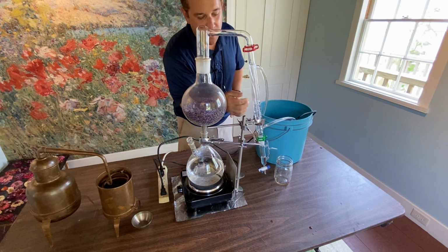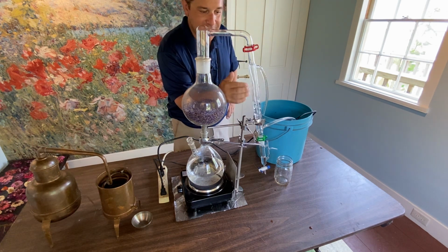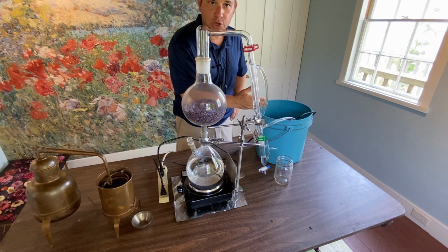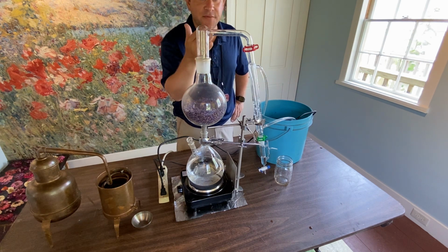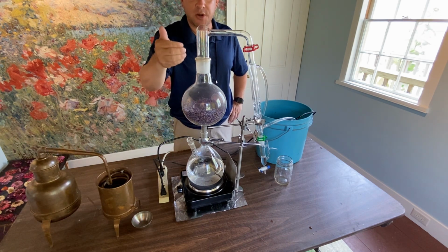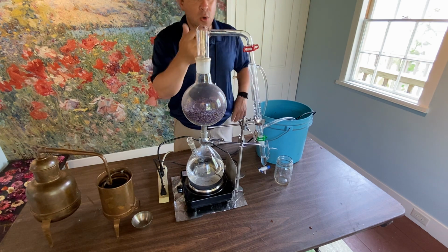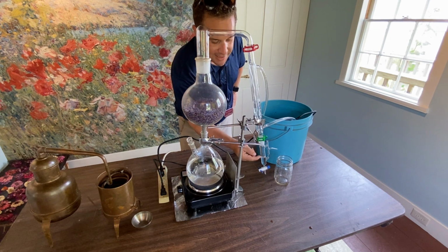So the inner tube that I'll show you in a bit with a little closer shot is where the steam accumulates. The outer tube allows really ice cold water to circulate around that tube with the steam. Now, eventually I'll put really, really cold ice in here, allowing that ice cold water to really condense any of the oils that come to this side. So again, we're drawing steam through plant material, that's pulling the oils out, and then those really fast particles moving around with high temperature, both water and oil, will then slow down with this condenser. Now eventually we'll see the oil accumulate down here.